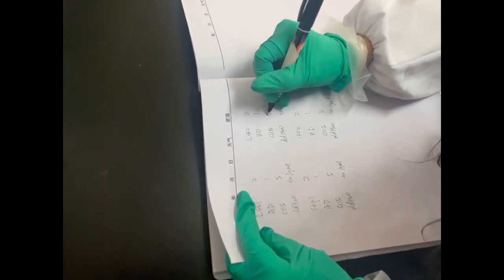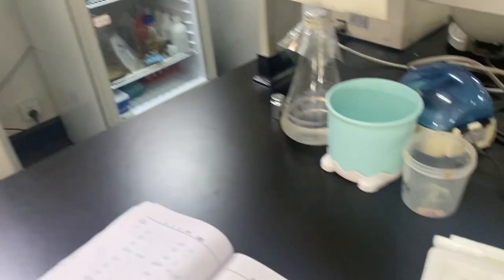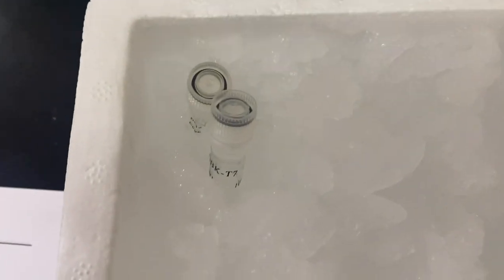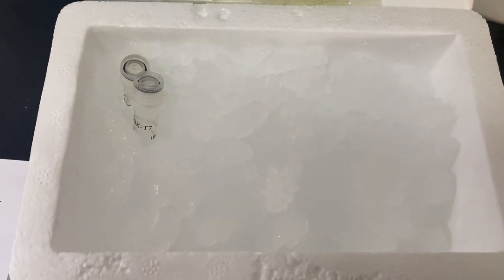The concentration for the BD vector would be the same as what we used for the AD vector. Remember to use ice while working with vectors. As with the AD vector, we need DH5α for PCR product transformation.